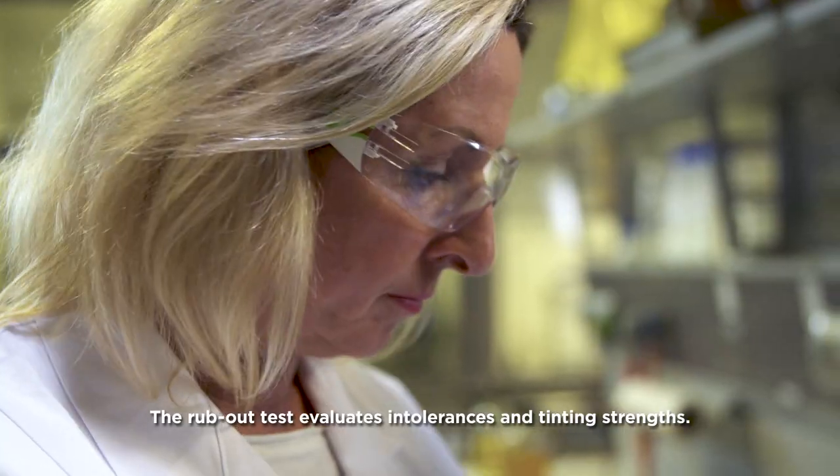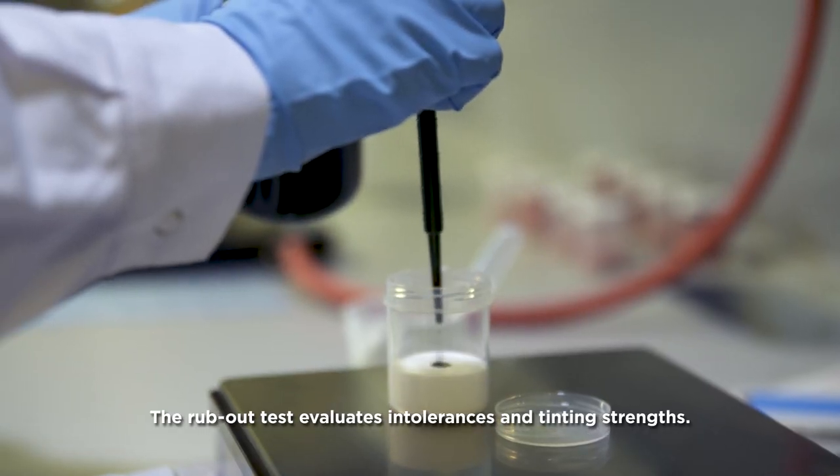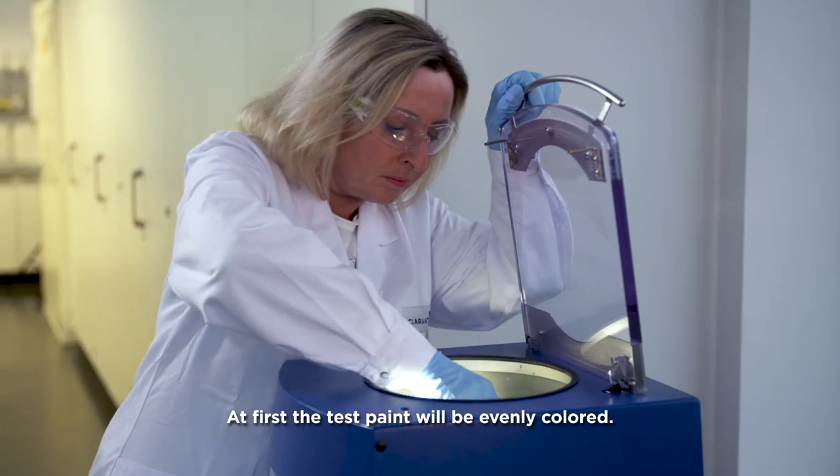The rub-out test evaluates intolerances and tinting strengths. At first, the test paint will be evenly colored, best done in the speed mixer.